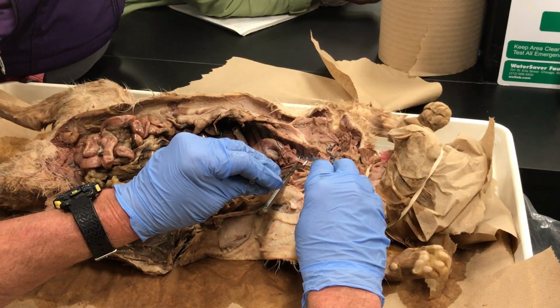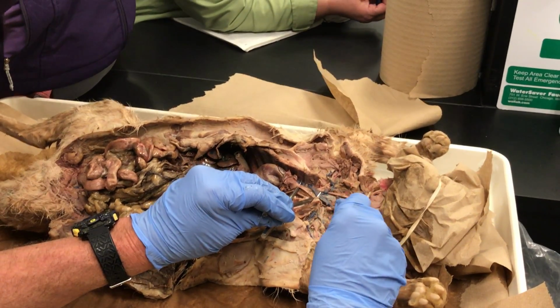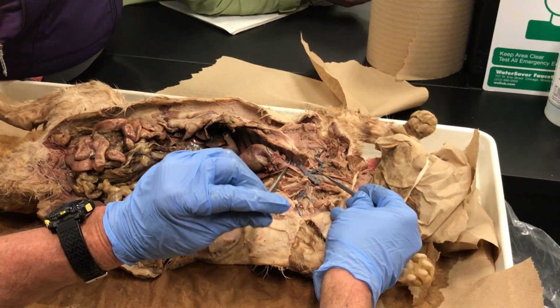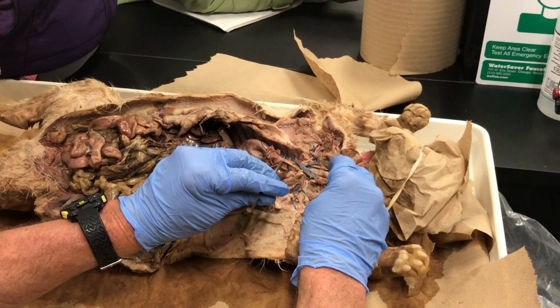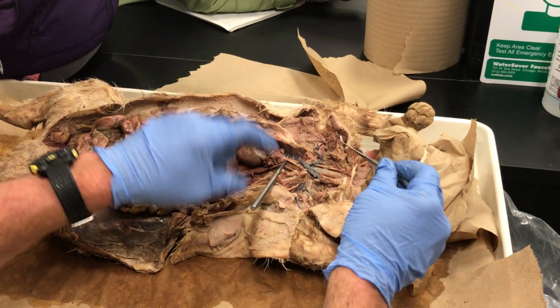Keep following the brachiocephalic. The second major branch goes up the other side of the windpipe. It is also a common carotid. What's left is under the clavicle, called subclavian. In the armpit it's called axillary, and way out in the arm it's called brachial. Beautiful.